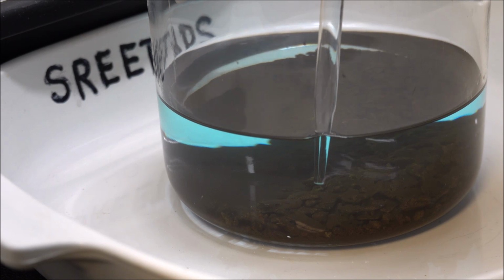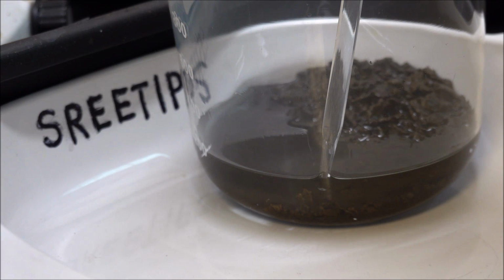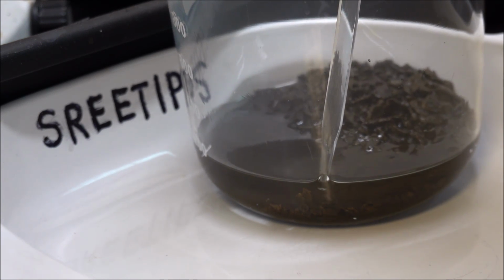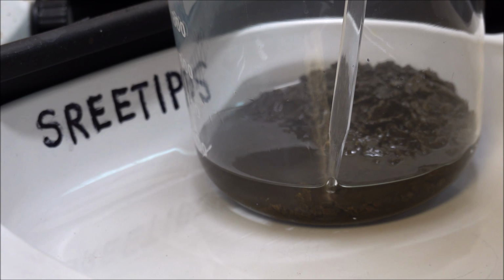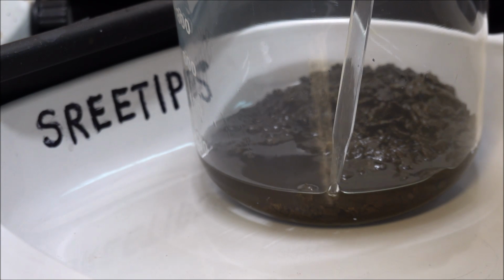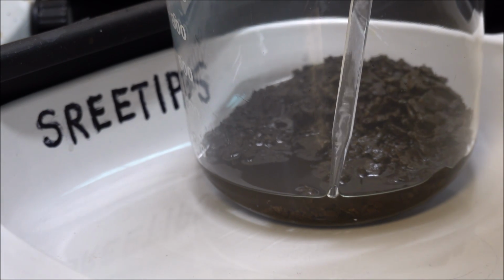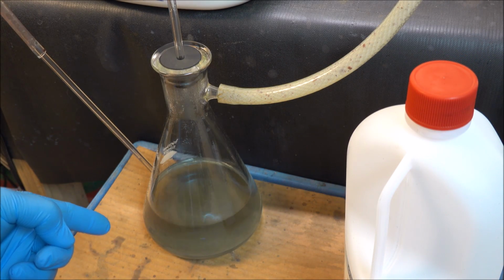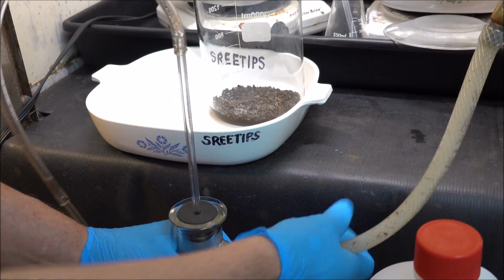This makes removing the silver-bearing solution sitting on top of the gold difficult. I can't pour it off quickly and easily like I did in previous videos, so I'm using a vacuum suction tube into a filter flask to get the solution off there. This is an undesirable condition and something that we want to try to avoid, and I'm going to demonstrate how to recover from it. I've got all of the solution pulled off of the granules up here. So now what I'm going to do is get this out of the way.